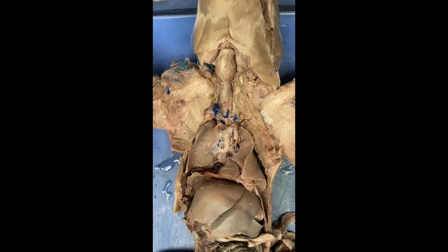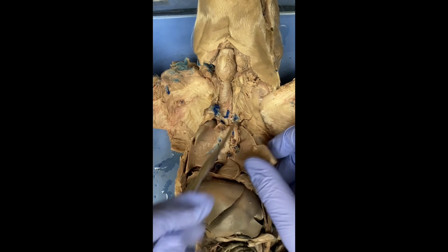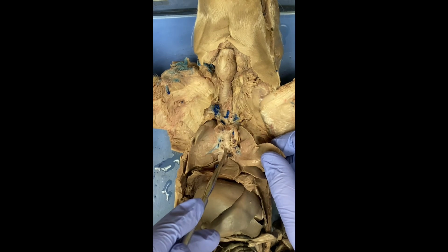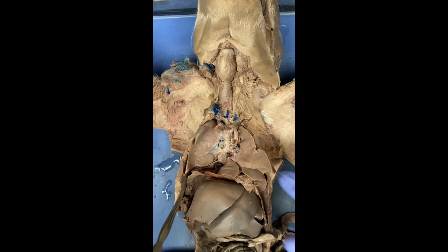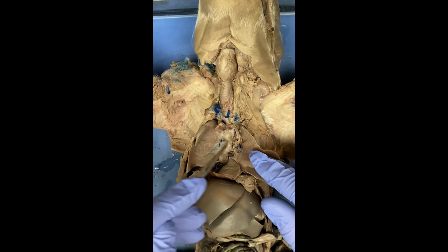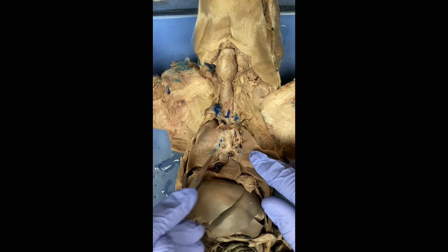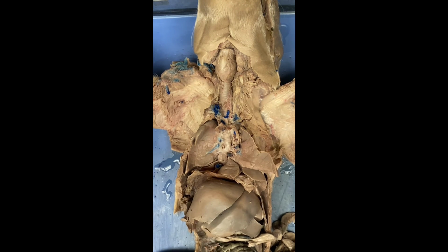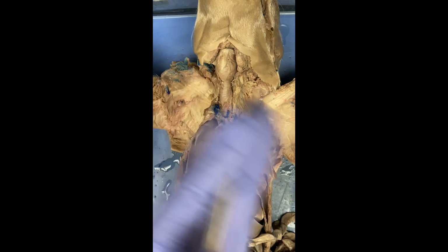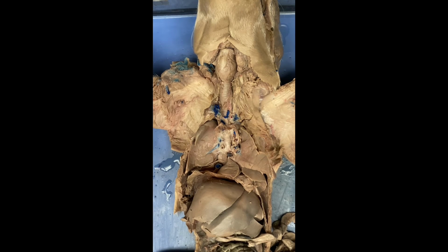And then finally, we have the bronchi, which, as we go down the trachea right here, is going to branch off into some bronchi. Because this has multiple lobes, there's actually a large quantity of a couple more bronchi down here. So trachea, and then these bronchi. There's going to be one here, and there's some elsewhere. They connect from the trachea, and it branches into the lungs. And that's going to be everything for the respiratory system, so a lot simpler compared to the nervous.